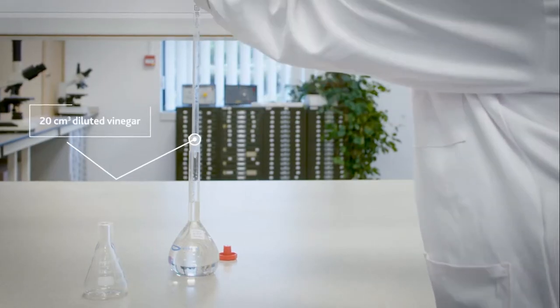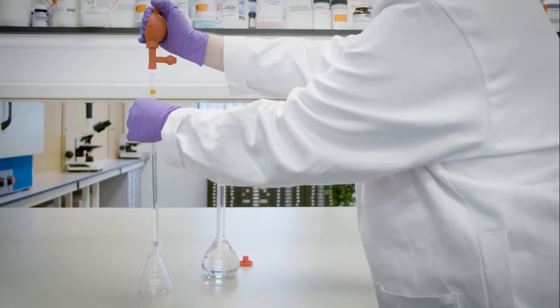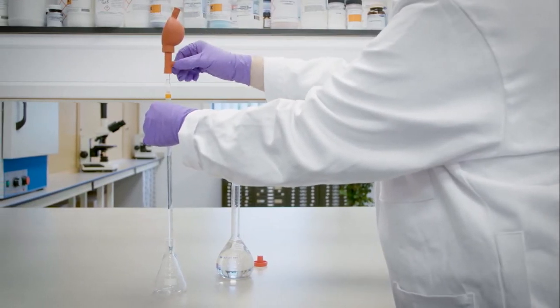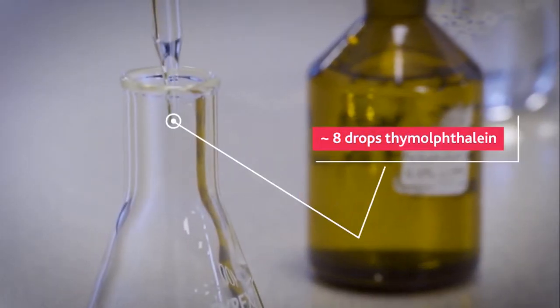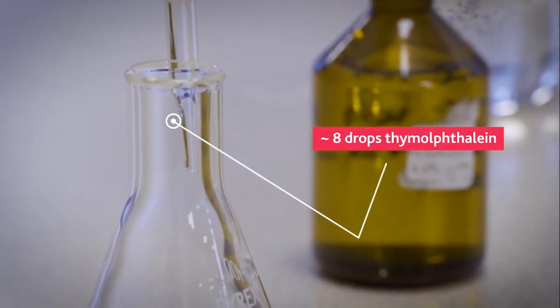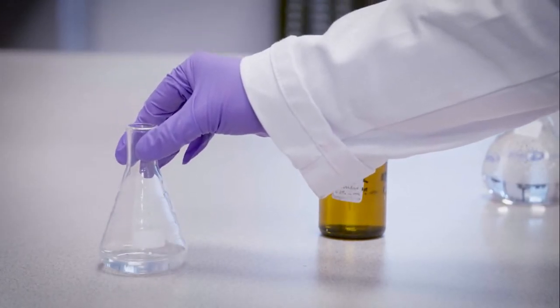A fresh pipette, rinsed with deionized water, is used to pipette out the diluted vinegar into a conical flask. Thymolphthalein indicator is added to the diluted vinegar, and the conical flask is swirled gently to aid mixing.